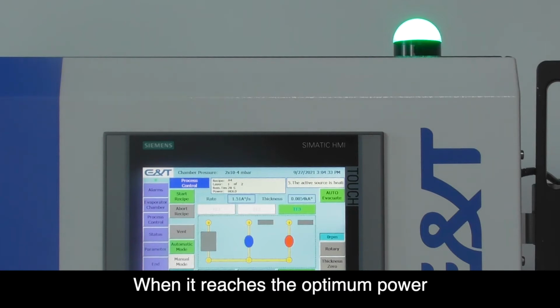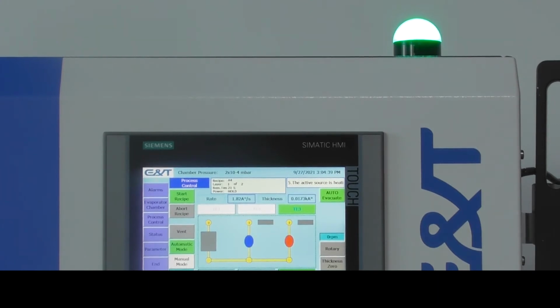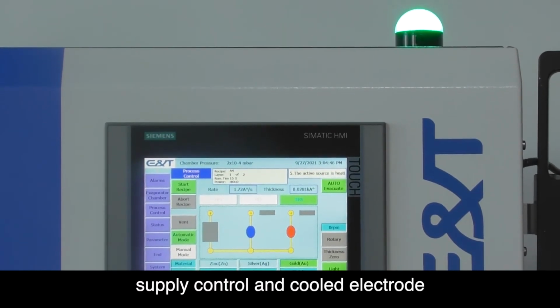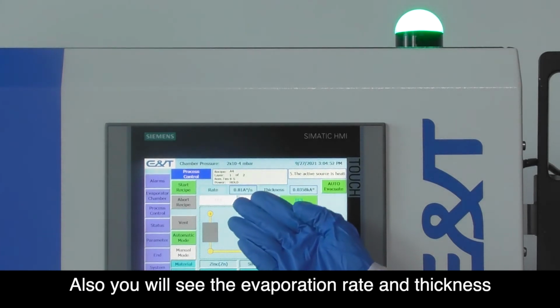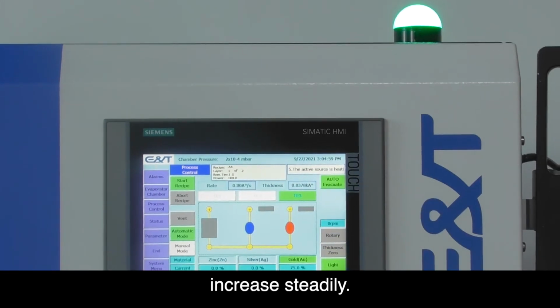When it reaches the optimum power, this can be held constant to make the evaporation stable. This is because the accurate power supply control and cooled electrode work together to have a stable evaporation temperature. Also, you will see the evaporation rate and thickness increase steadily.